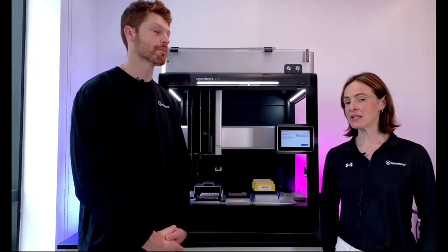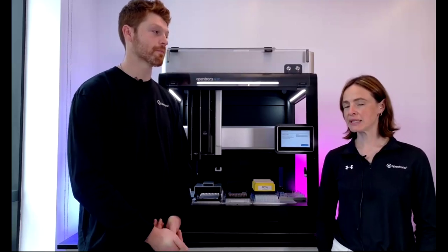All right, that's a quick answer. Maybe one more quick one. Is the HEPA UV module strong enough to do mammalian cell culture? It certainly is. We definitely have a number of customers who are doing exactly that.